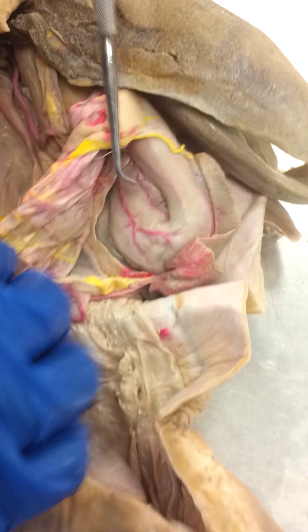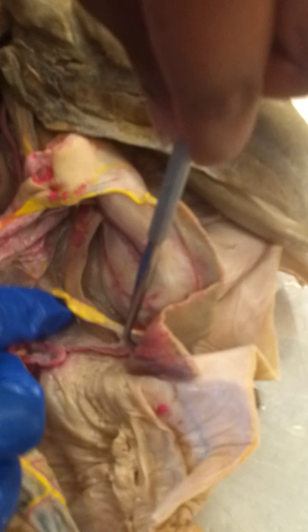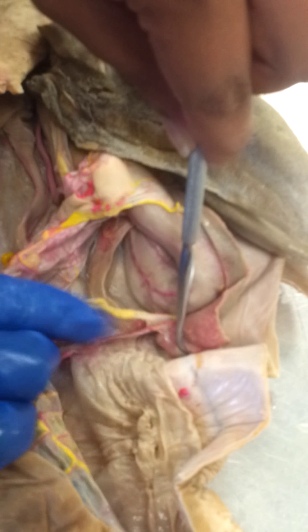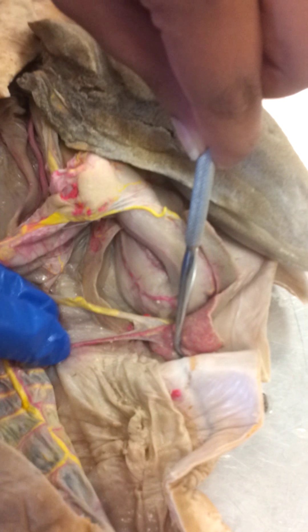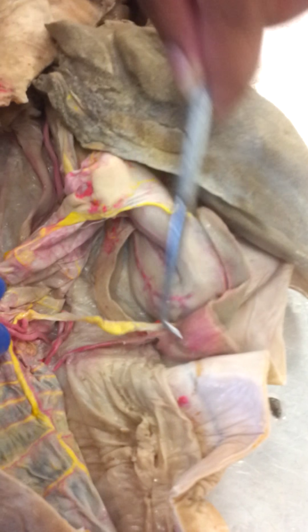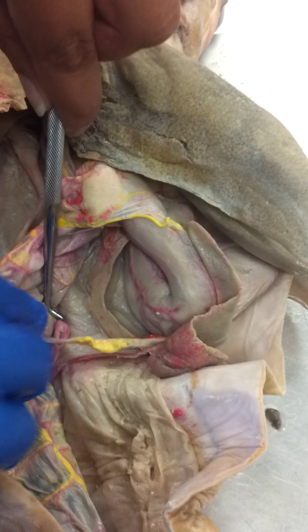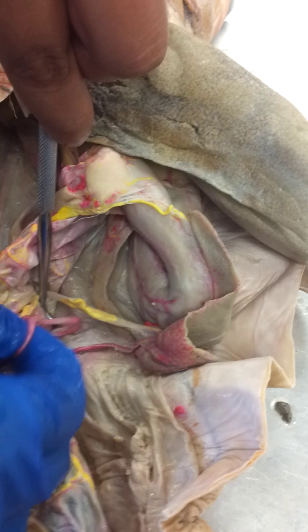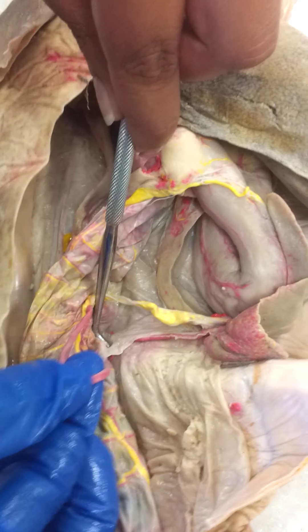Your gastrosplenic artery stems off of your spleen, which is right here. And your anterior mesenteric artery is here.